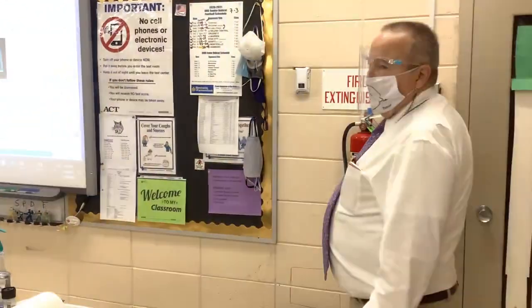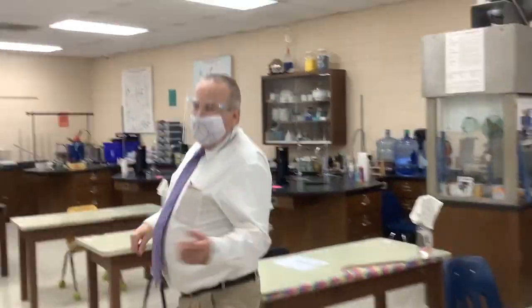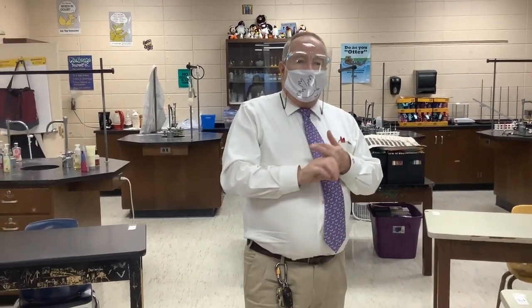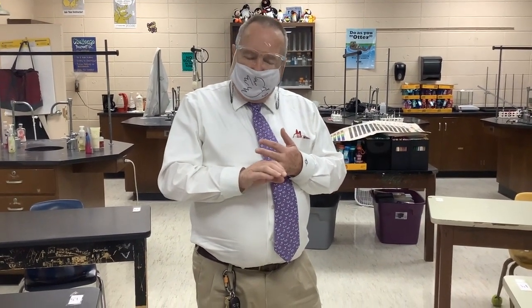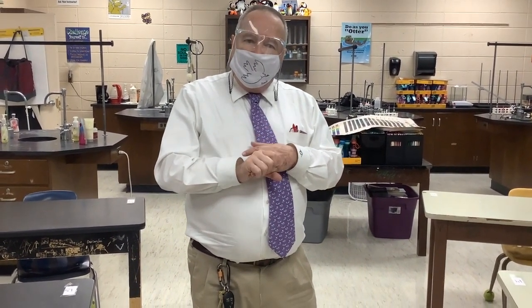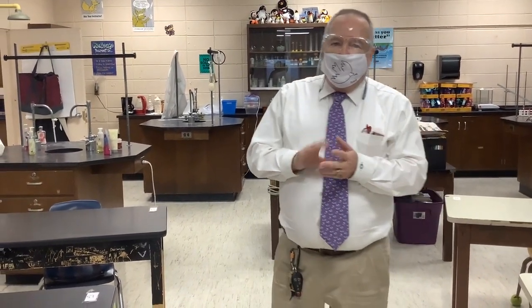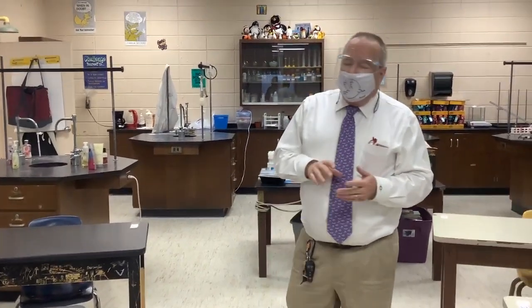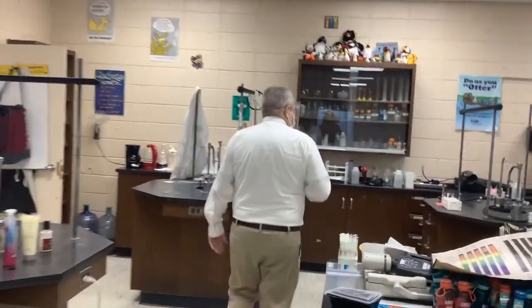I'm going to turn the lights on so we can go back to the lab. We'll be using Bunsen burners. The next lab, we're going to do more flame tests, and we're going to boil water so that we can follow some chemical reactions. And I'll have a separate video on how to safely light and use a burner and how to safely boil water. So today, I'll just quickly run through our lab.